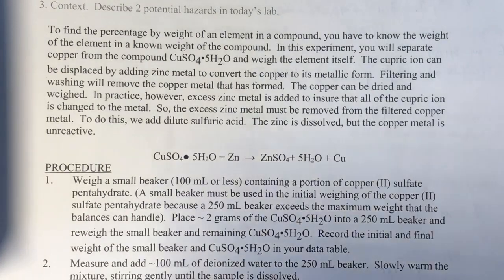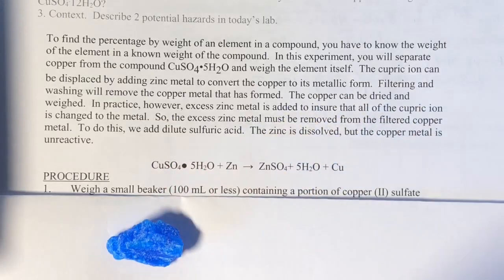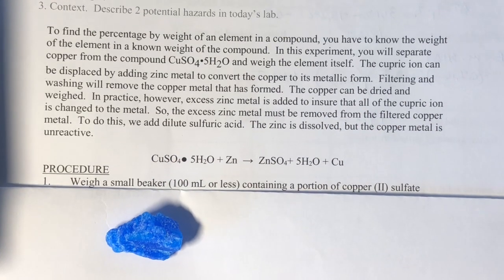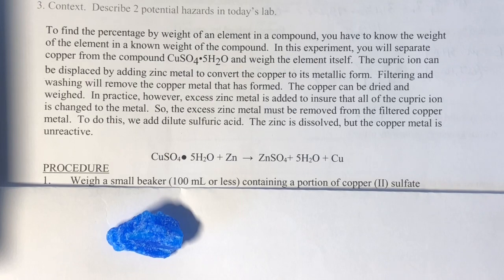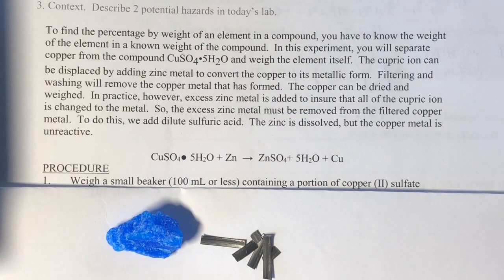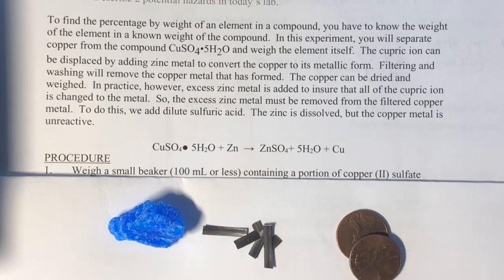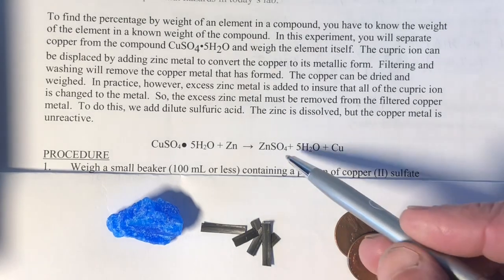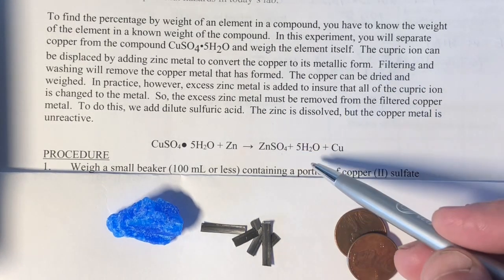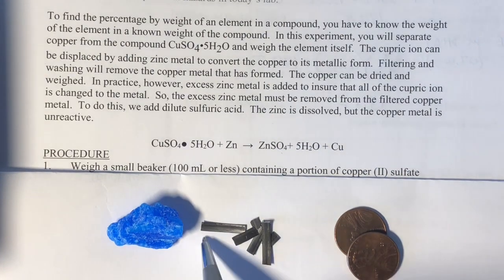It's kind of a fun reaction because it's colorful, but what we're doing is taking copper sulfate and letting that combine with a readily oxidizable metal. In the experiment we do at school we use zinc, though today I'm going to try doing it with magnesium and see if that works. And ultimately what happens is we form copper metal. We're also of course going to have the leftover aqueous zinc sulfate that gets washed away and the water that is locked into the crystal of the copper sulfate.